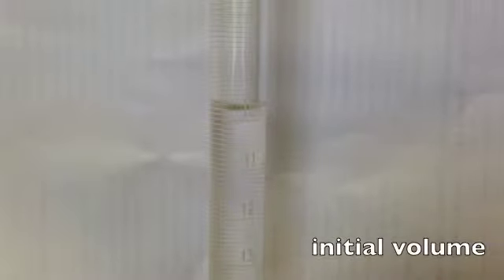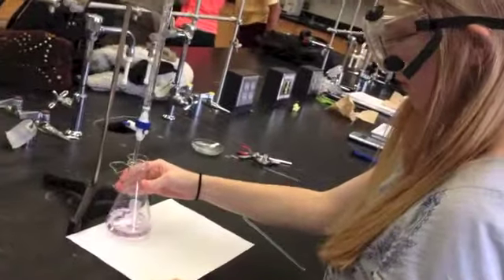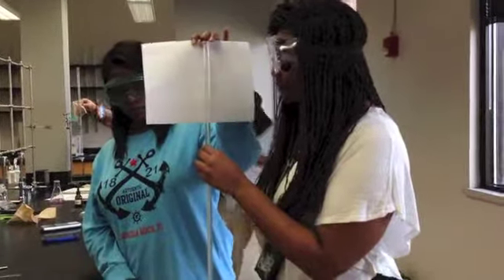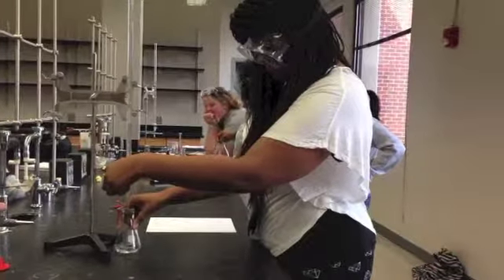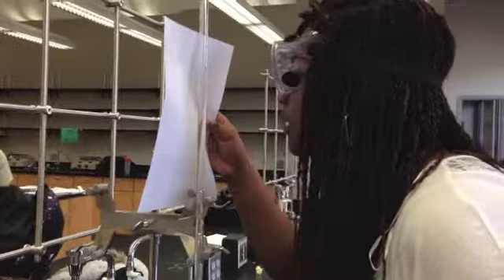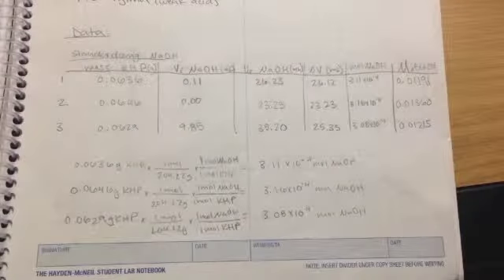Before performing the titration, you must know the concentration of the standard solution, the initial volume of the analyte, and the mass of the standard solution that will react with the analyte. To determine the unknown variable, in this case the concentration of the analyte, you must use the moles of sodium hydroxide, which was determined by the mass of KHP, and then divide that by the volume of sodium hydroxide. The data for each trial should be recorded in your lab notebook.